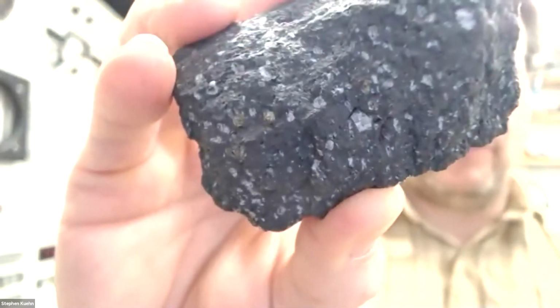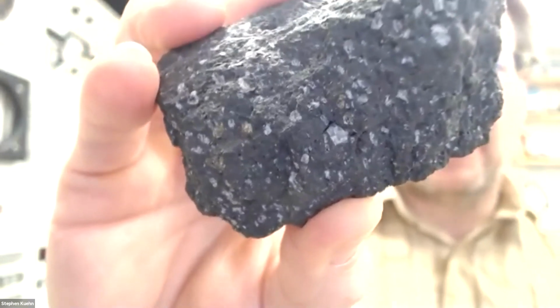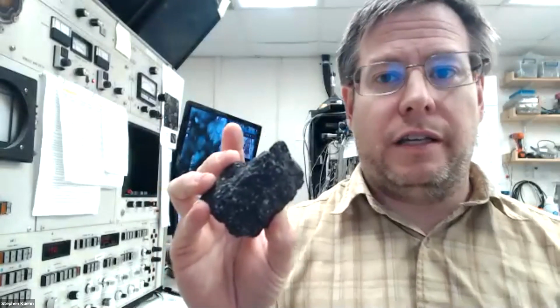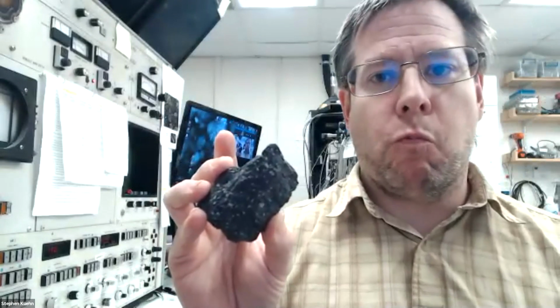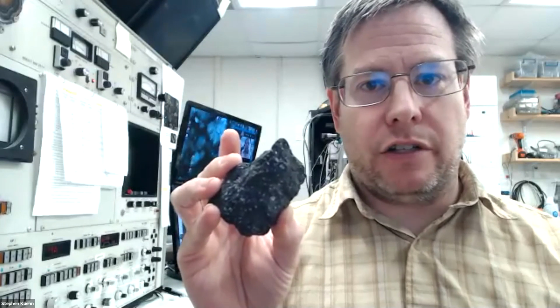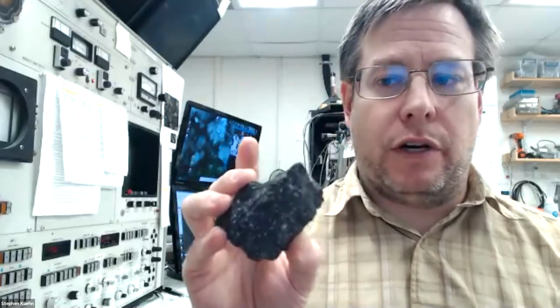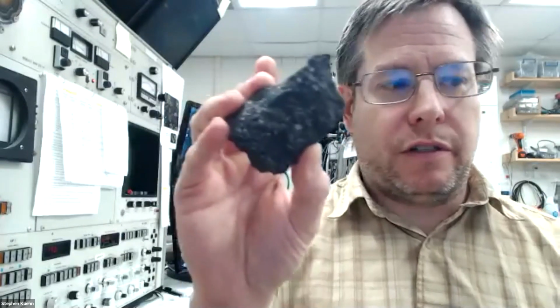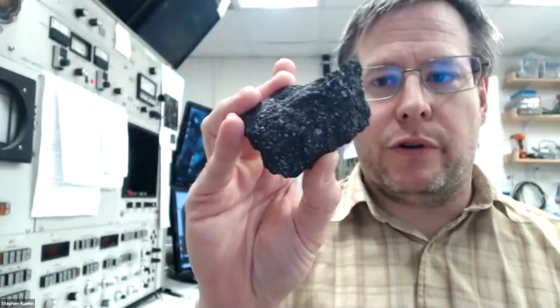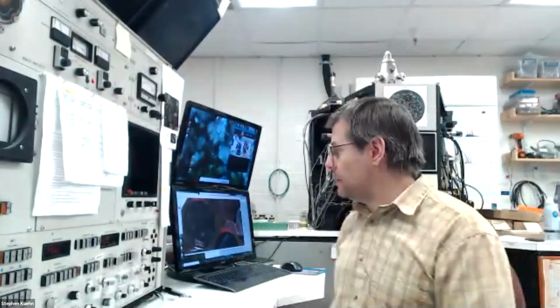All right, so that means we're probably going to want to try to figure out what those 2 minerals are. And again, you could try to do it just based on the color. It's like, okay, there's a white one and a green one in a mafic kind of rock. What options might fit? Okay, and there's a short list of things like olivine and plagioclase and amphibole and pyroxene and so on. So which of those are most likely to be white or green? And we could probably narrow it down pretty quickly that way. But let's see what we get with some chemistry.